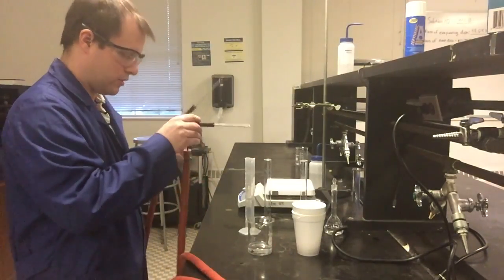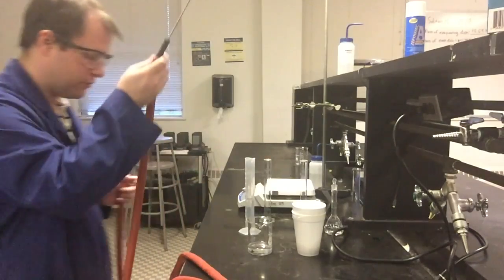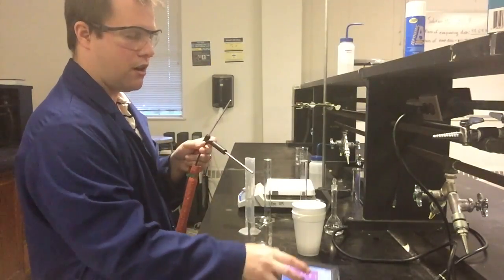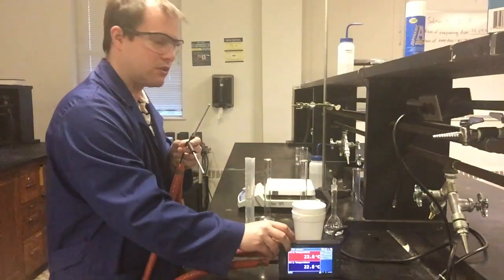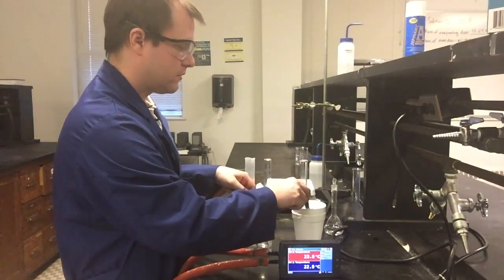All right, and so this time, the red temperature, the top one, I'm going to put it with the beaker again, which is the same thing that I had previously. And then I'm going to have the blue temperature, which is the bottom one that you see here on the LabQuest. If I pop it up, so hopefully you can see the temperatures okay. If I back this up just a little bit so you can actually see them. And so blue going in the styrofoam cup, red going into the beaker.